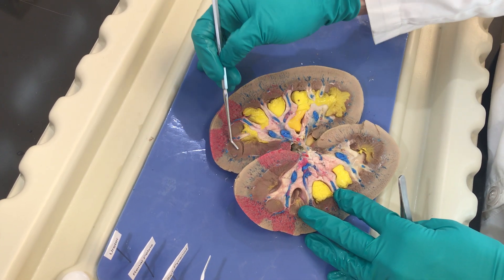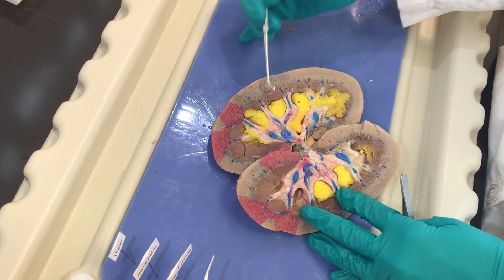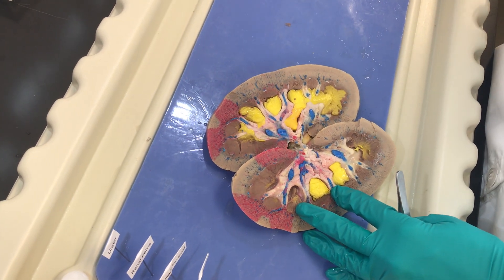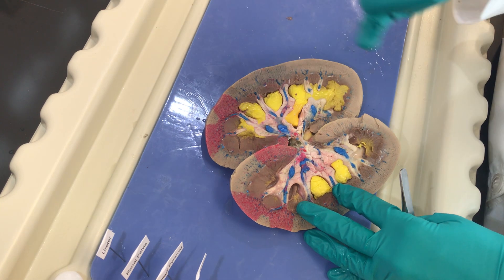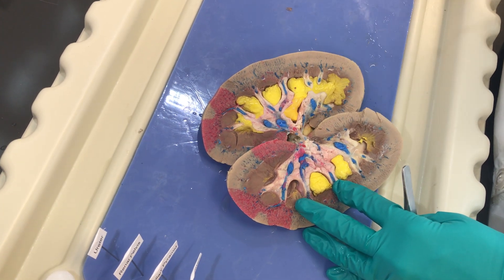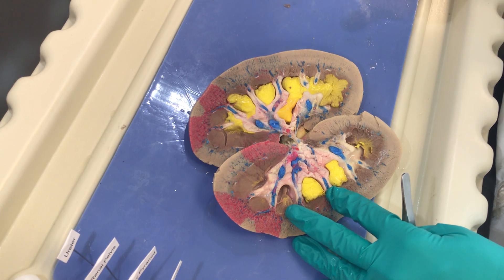These darkened areas are called our medullary pyramids. This is the deeper tissue, and remember this is where we have that interstitial concentration gradient, which allows our loops of Henle to extend down into those areas and increase our water reabsorption.